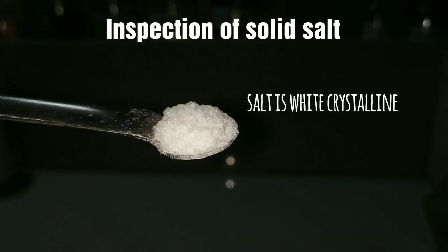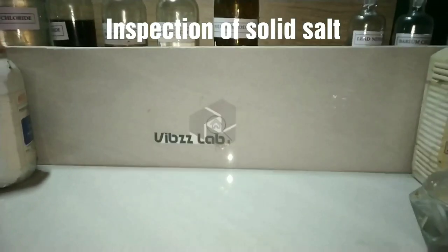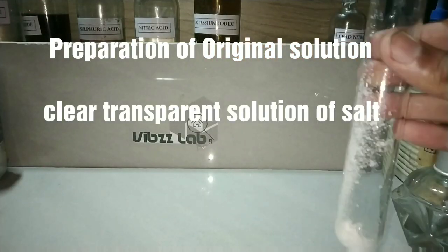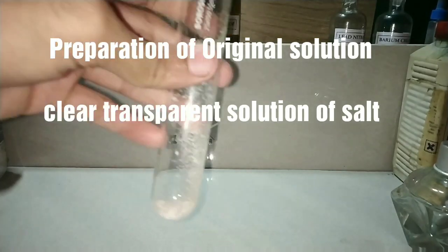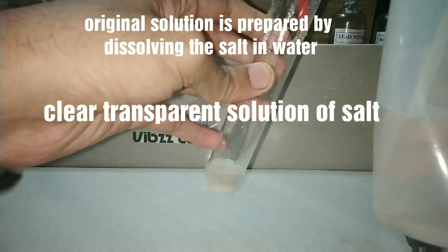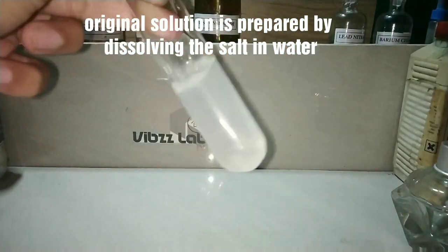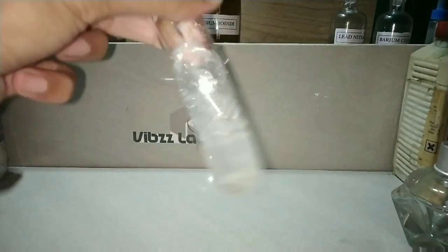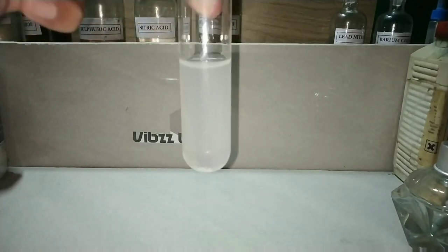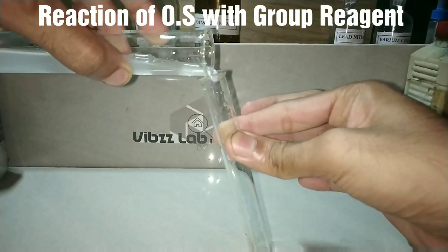The solid salt is white and crystalline. Now we prepare the original solution. The original solution is a clear, transparent solution of the salt, most commonly prepared by dissolving the salt in water. If the salt is insoluble in water, we prepare it by other methods which will be described later.